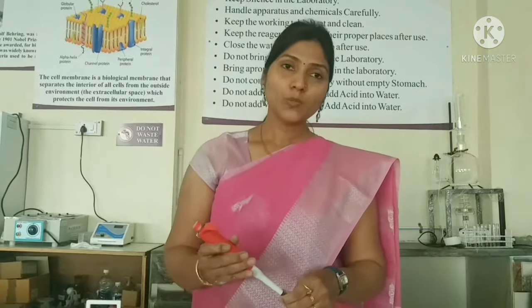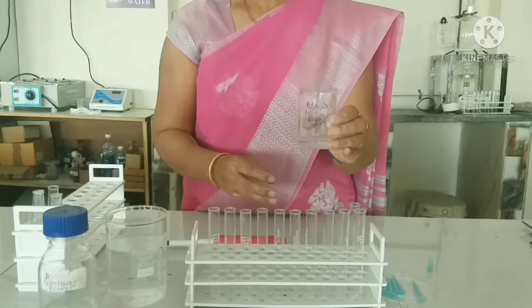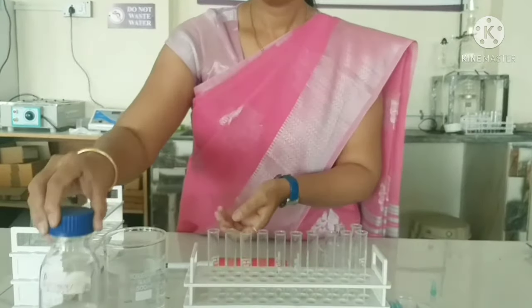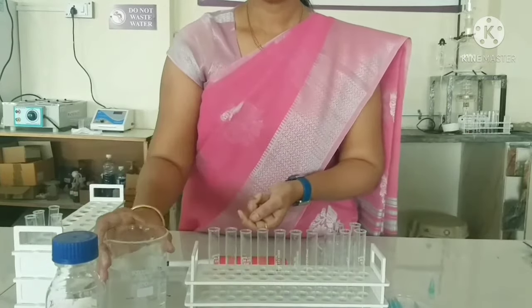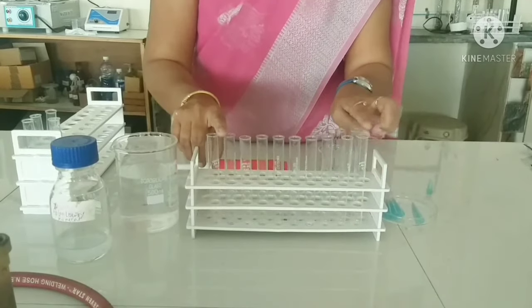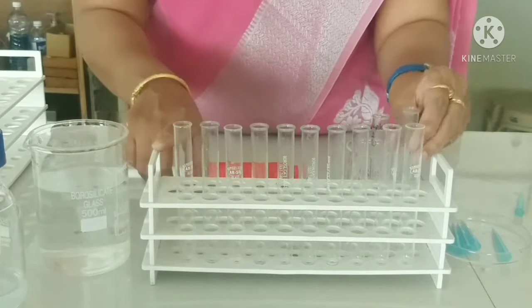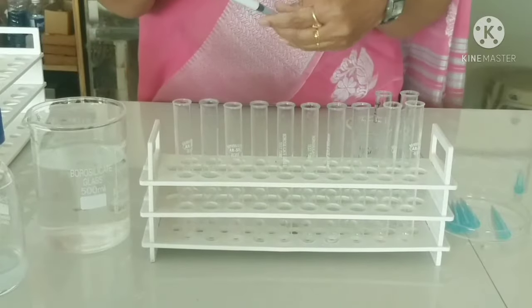Now let's do this practically. We need BSA bovine serum albumin stock at 1000 micrograms per ml, the Folin-Lowry reagent, the Folin-Ciocalteu reagent, distilled water, and 10 test tubes labeled 100, 200, 300, 400, 500, 600, 700, 800, 900 and 1000 micrograms per ml, plus one blank tube and one test sample tube.